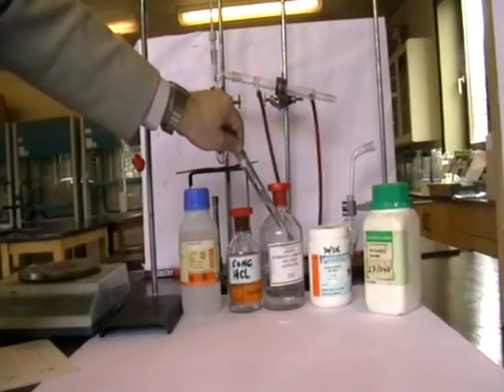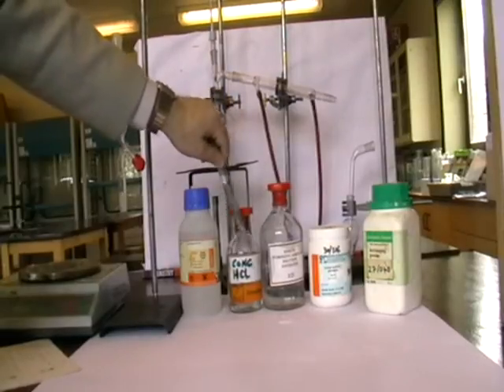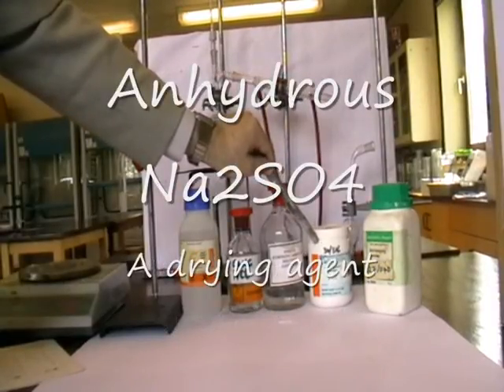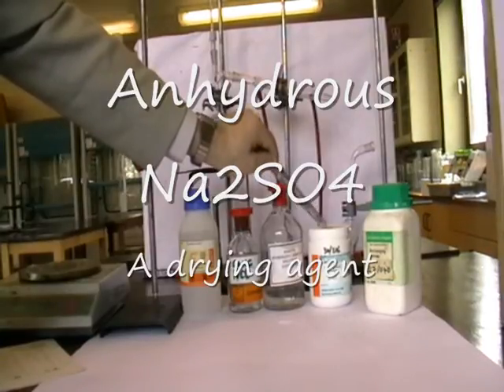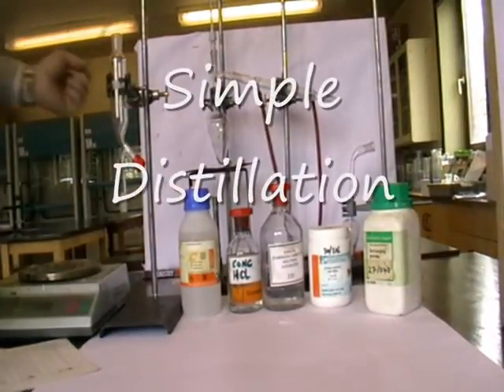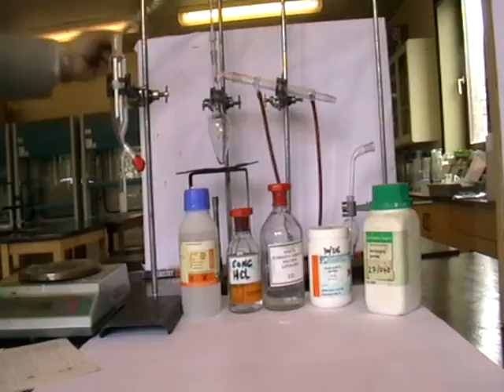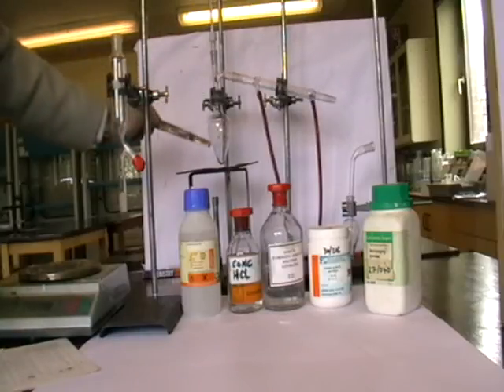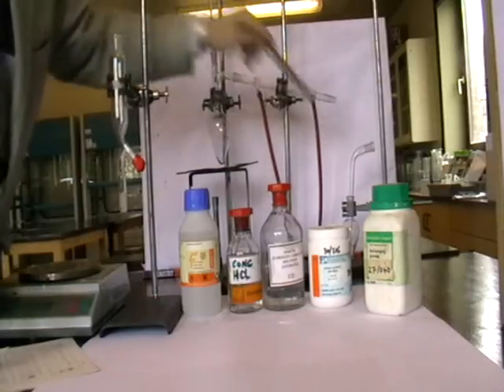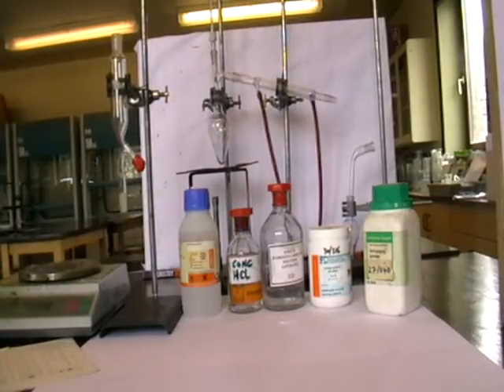I've got aqueous sodium hydrogen carbonate, which will be used to remove the excess hydrochloric acid. I've also got anhydrous sodium sulphate, which will be used to dry the product and remove the water — it will be shaken with that for about 5 minutes. Once I've got to that stage, I will carry out simple distillation and collect the fraction over a particular temperature range. This is my simple distillation setup with a pear-shaped reaction flask, Liebig condenser, and over here we will collect the product in a weighed pear-shaped flask over that particular temperature range.